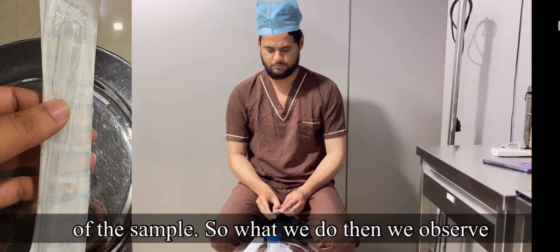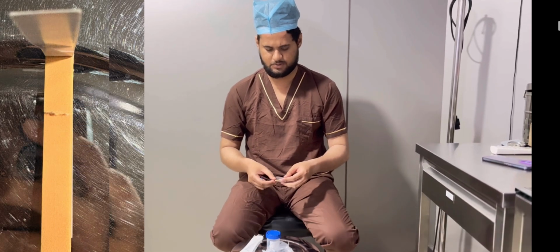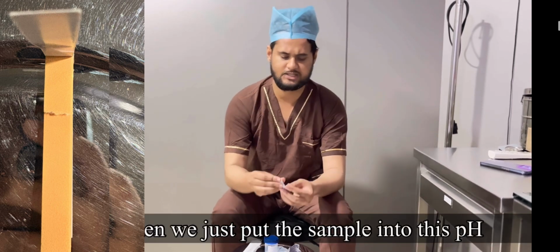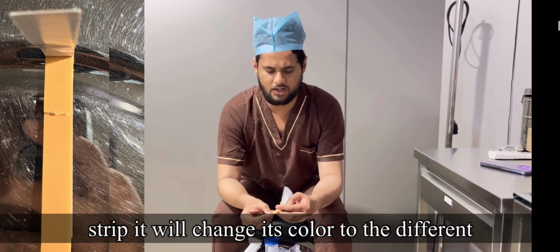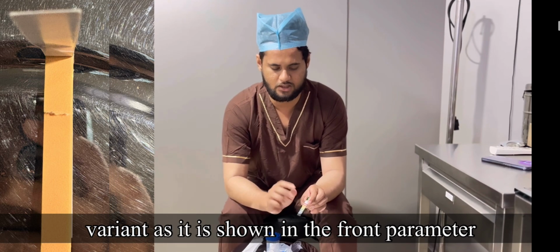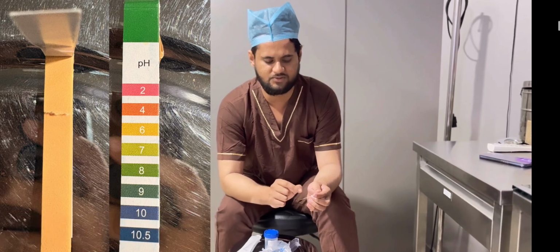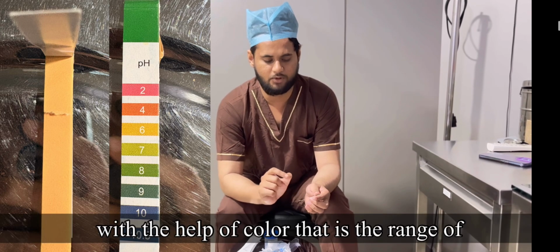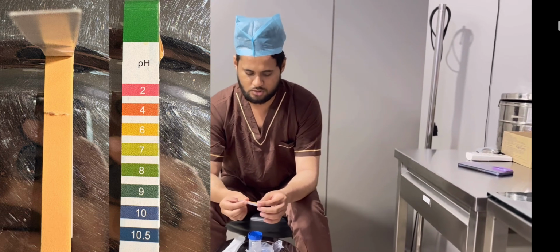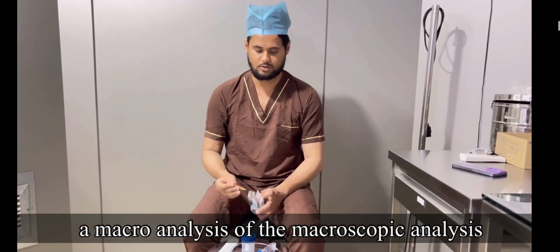When we observe the pH of the sample, we take the pH strip, and when we put the sample onto this pH strip, it will change color to a different gradient, as shown in the front parameter of the pH strip. As per the pH strip parameters, we can figure out with the help of color what range the semen sample falls under for pH. So these are the basic requirements for macroscopic analysis of the semen sample.